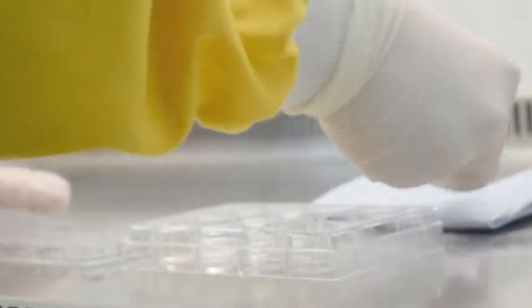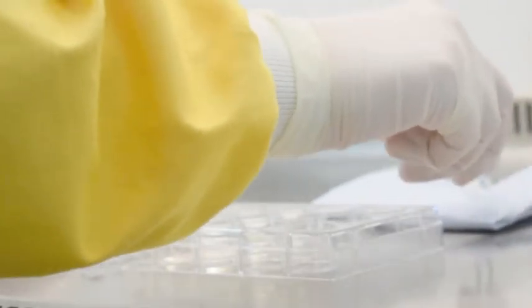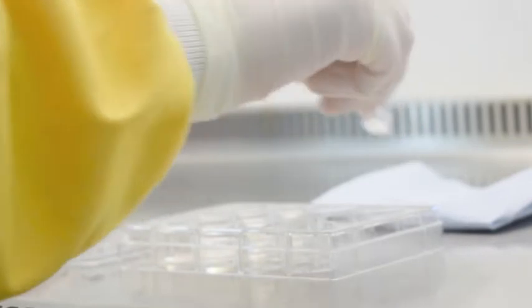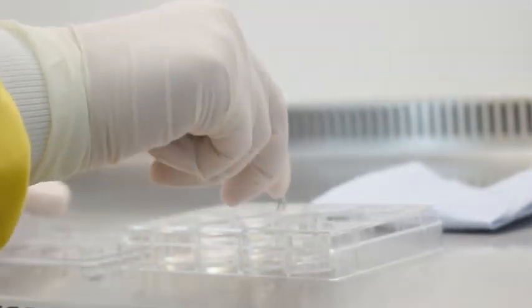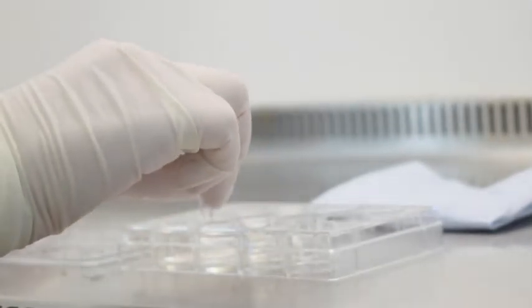Each tissue is then removed from the DPBS, excess liquid is blotted, and the tissues are lowered into the second wash of EDTA.